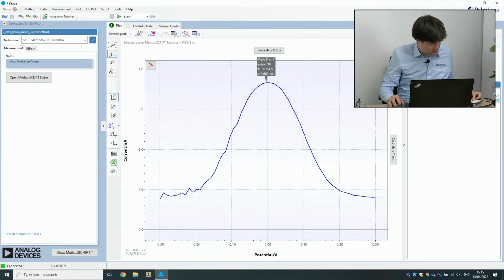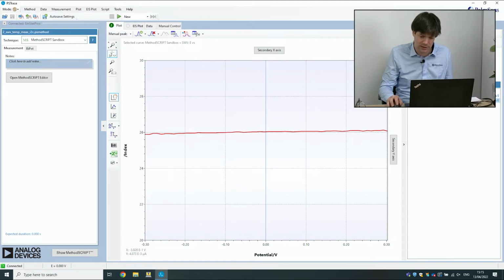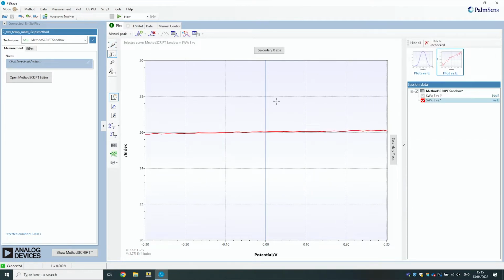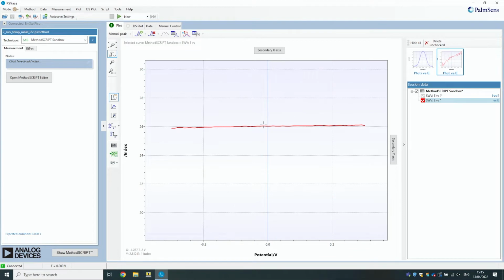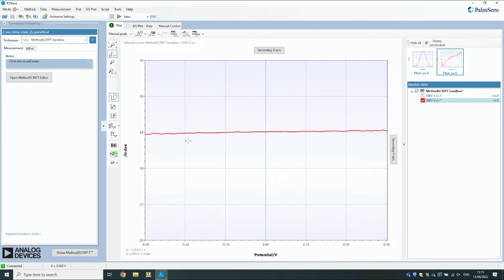Yeah, so now we have to show the temperature as well. So this is the normal measurement, and this is the other variable that we've added. PSTrace has interpreted this as another type of value, so you want it to be in a different graph, because this is temperature, while here we were measuring current. So we can see here 26 degrees, and it's going up a little bit because the device is busy, so it will heat up a little bit.